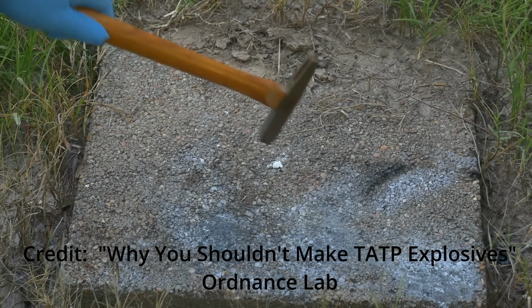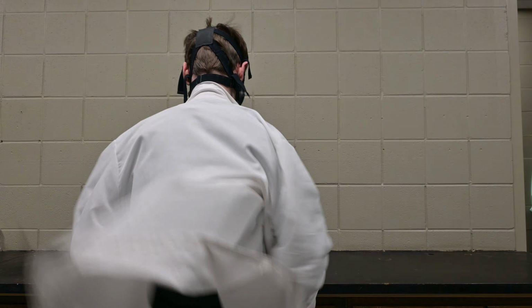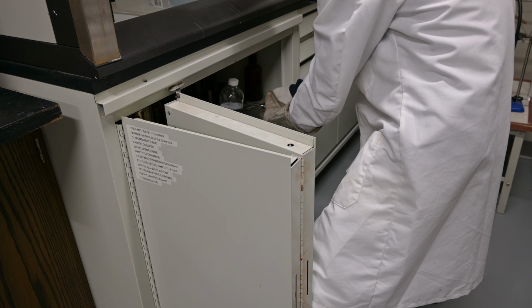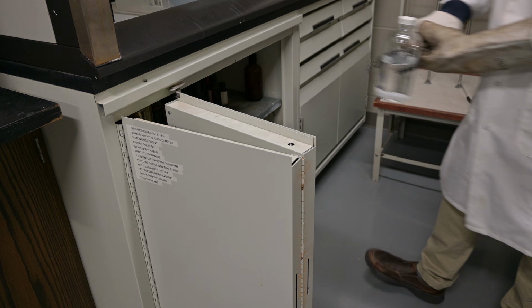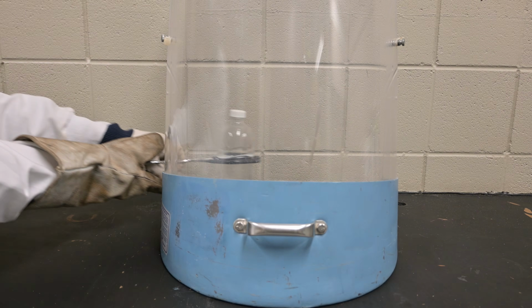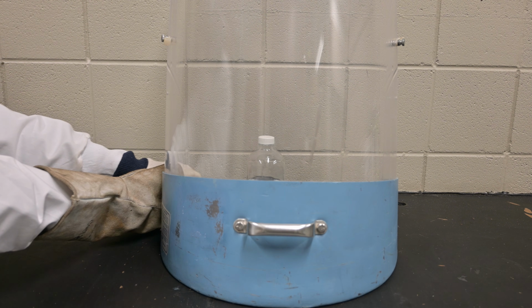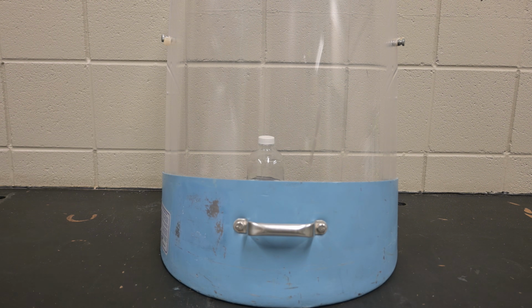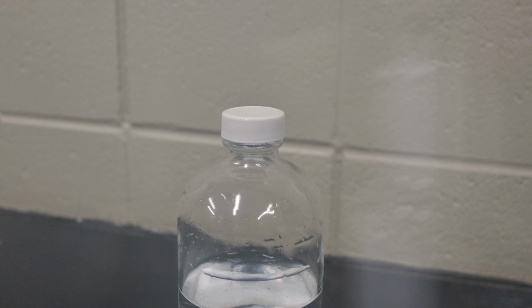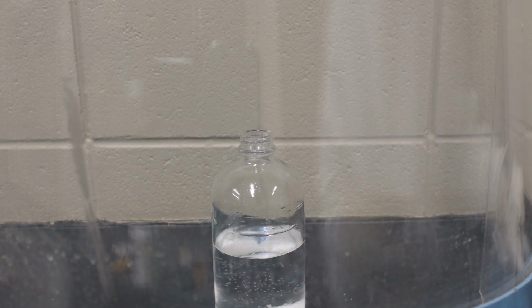To minimize risk, I suited up in full protective gear: face shield, welding gloves, and a lab coat, and carefully moved the bottle behind a blast shield. The first thing I did was to inspect the bottle's lid, to see if there were any crystals on the lid, which would be a clear sign that the bottle was unsafe to open. In my case, the lid was clear, so I proceeded with caution.